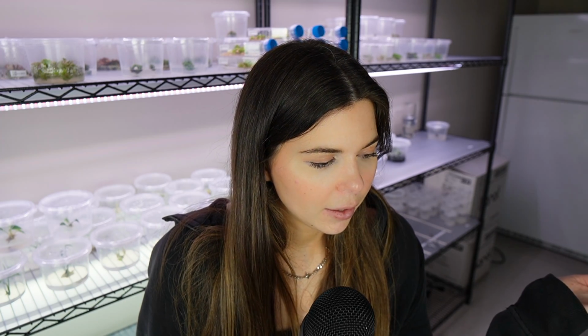So after all this testing, what is the verdict on the TopFin tissue culture plants from Petsmart? If you're just buying these plants to acclimate and toss into a freshwater fish tank, I think they're probably perfectly fine. If you're buying these plants with the intent to subculture them, like I did today, I wouldn't recommend it because 2/3 of the cultures were contaminated and the third had a bug in it.